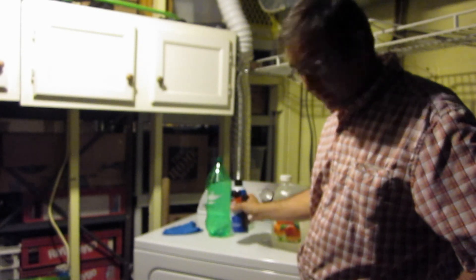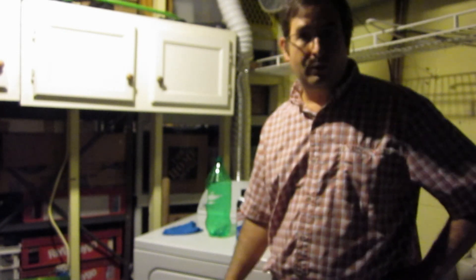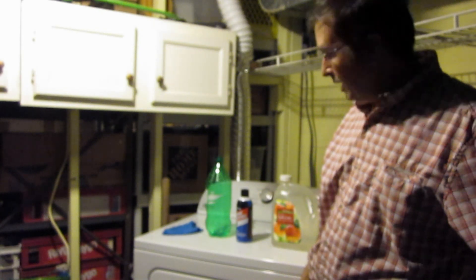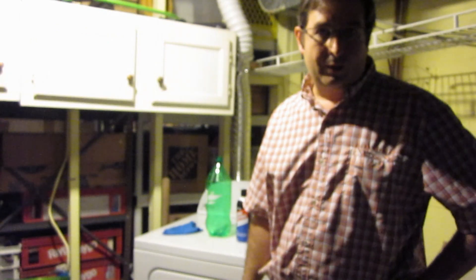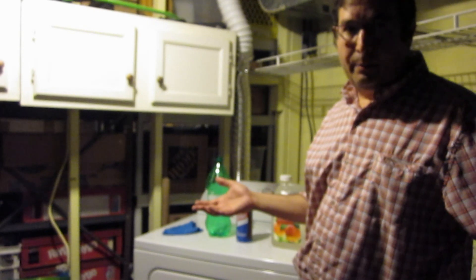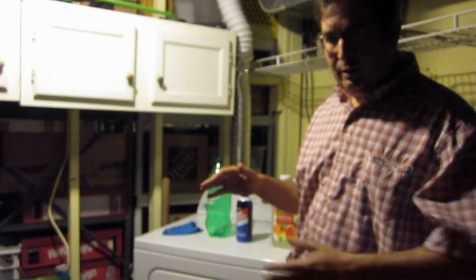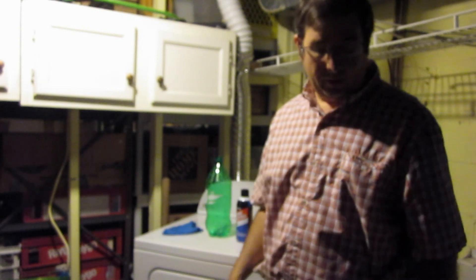It's in starter fluid, so this is what you're going to need to make your diethyl ether. Just in case any of you want to use it for your mad scientist experiments, like for extracting uranium salts or other things — it's very good for solvent extraction. The ether will actually float on top of the water, and it can leach salts that are dissolved in the water into the ether. The ether will not dissolve in the water, so you can separate them very easily.